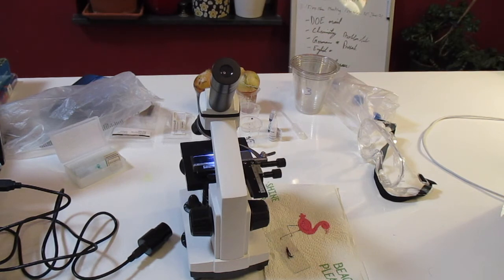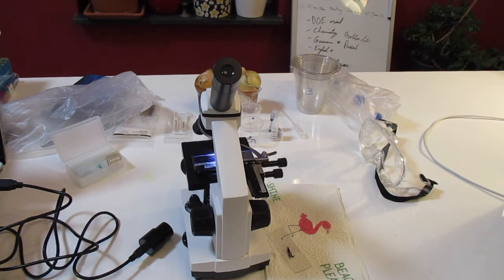Hello, welcome to my lab. Today we will investigate the environmental effect on mitosis. What is the objective of this lab? It is to observe the effect of caffeine on the rate of mitosis, and caffeine will act as the environmental factor. The rate of growth of the onion roots will be observed and quantified when exposed to the environmental chemical caffeine in the form of coffee.